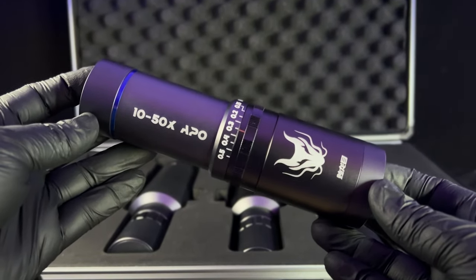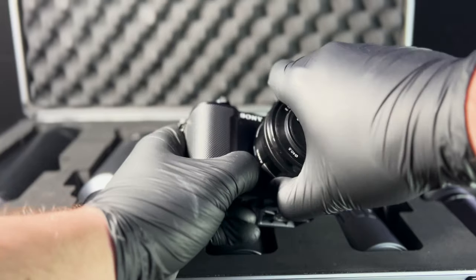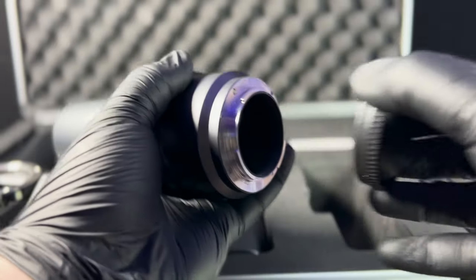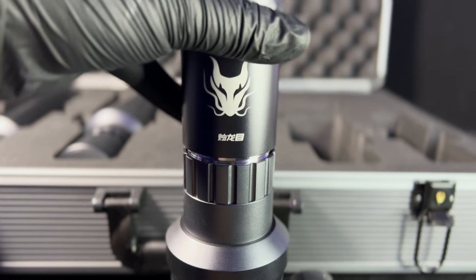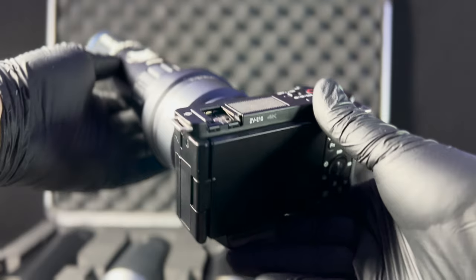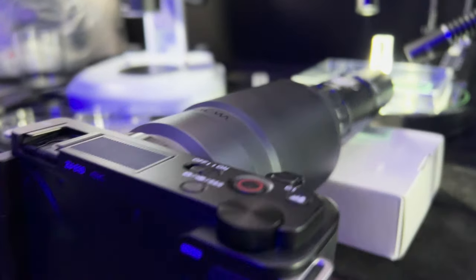But this is the key — the objective lens. I'll be mounting the lenses to my Sony ZV-E10. This is actually a vlogging camera but it has an interchangeable lens so it should work. Might look a little weird but doesn't matter. I've clicked in the tube lens to the camera and I am now attaching the objective lens. It's got that easy mounting thread. And this is the final result — this is how I have set up my camera.